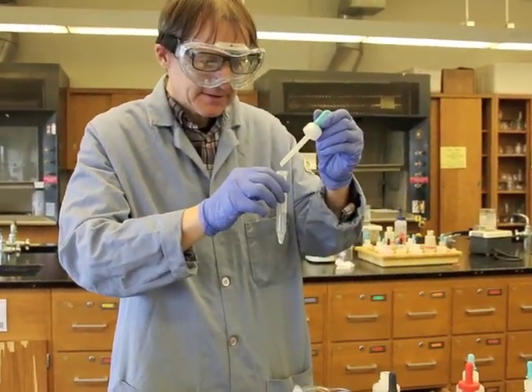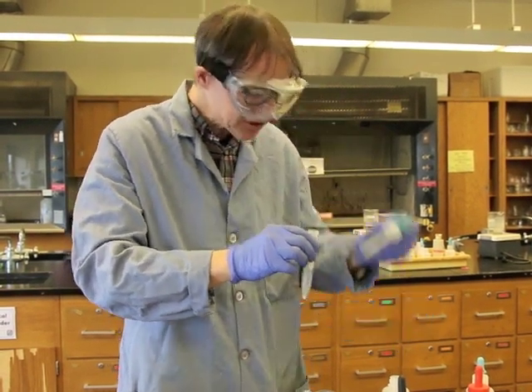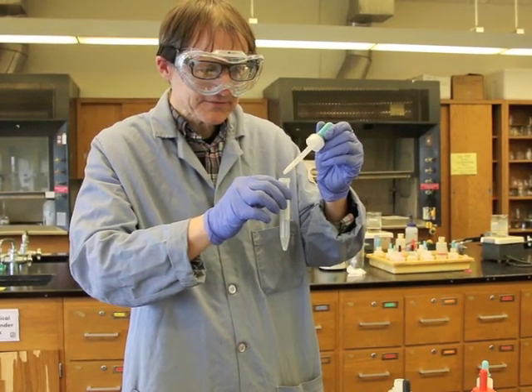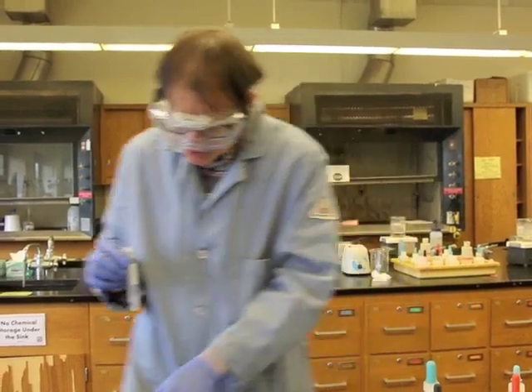I'm going to add a total of 15 drops. 11, 12, 13, 14, 15. There we go. And we're going to see if this dissolves.